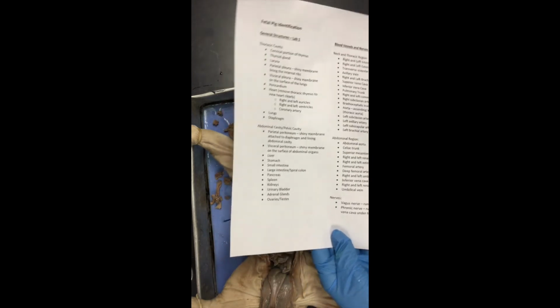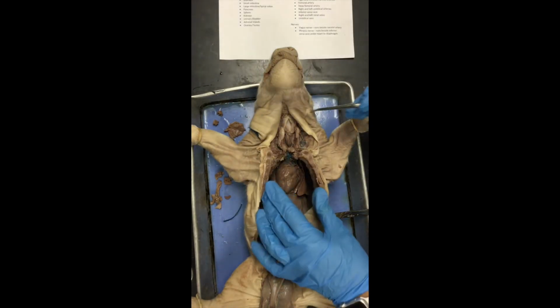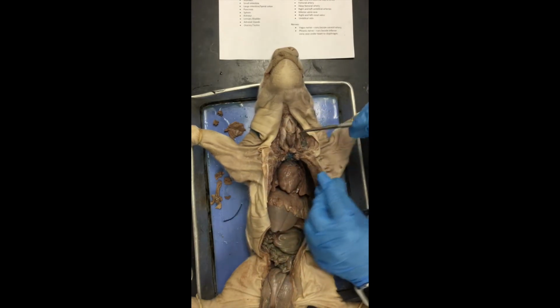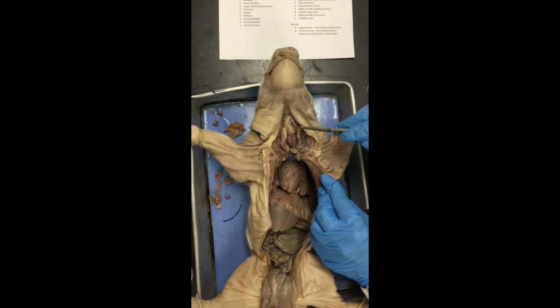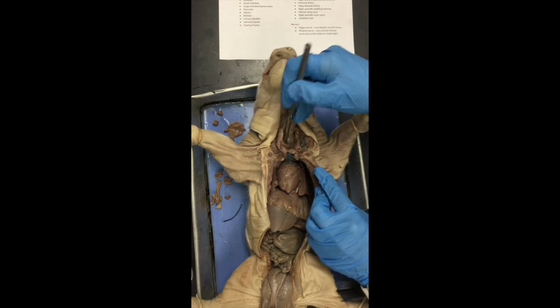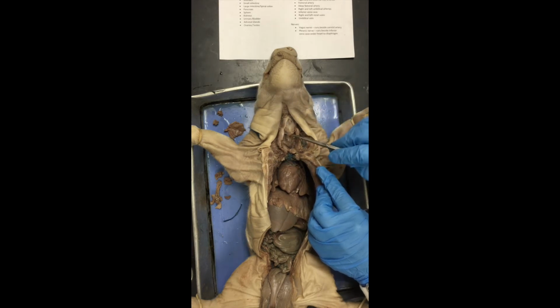So starting at the top, some of this we saw on the previous video. We've got the cervical portion of the thymus here and here, those two lobes. The thyroid gland lies right in the middle, medial to those. And then we've got our larynx, which is here. And I'm going to go ahead and point out the trachea again, even though it's not on that list for now. It'll appear later, but for now, this is our trachea right here too.